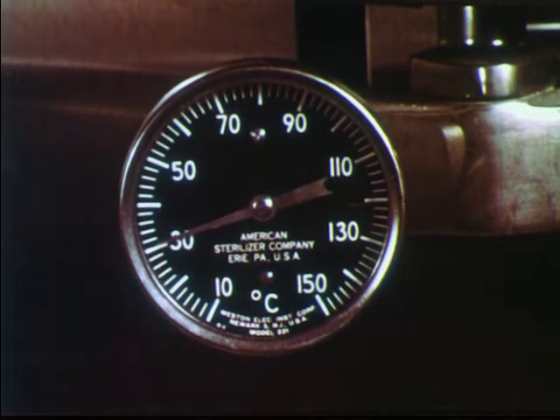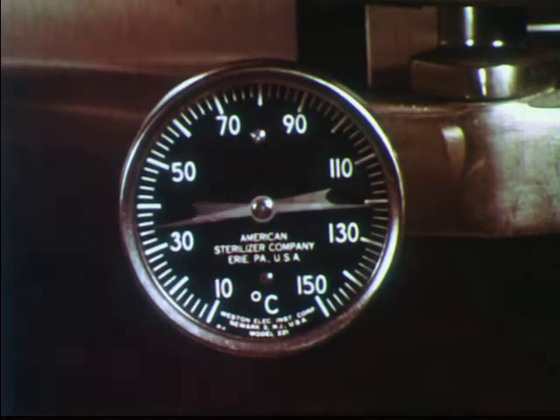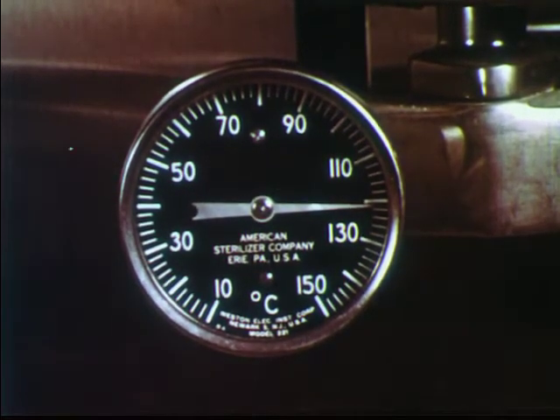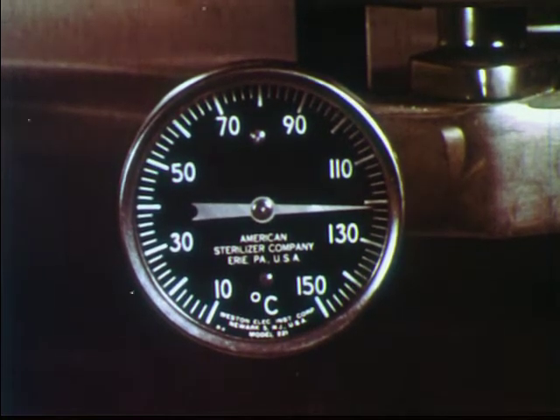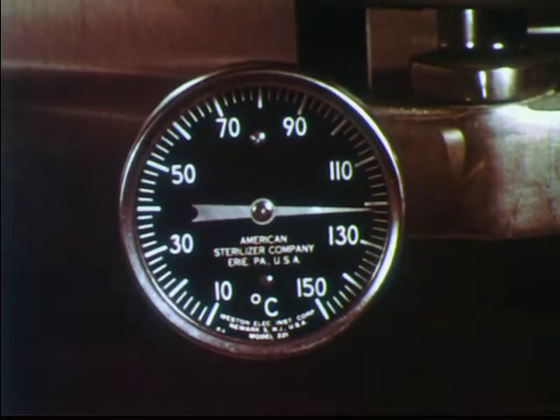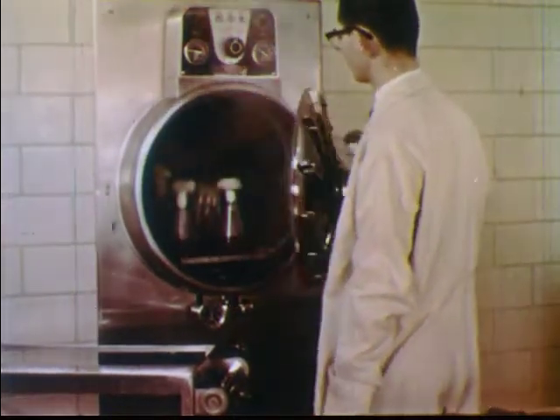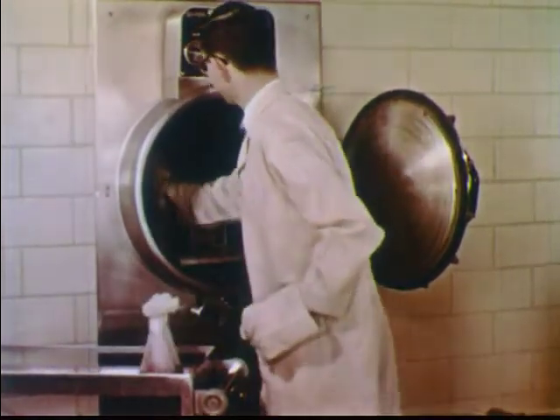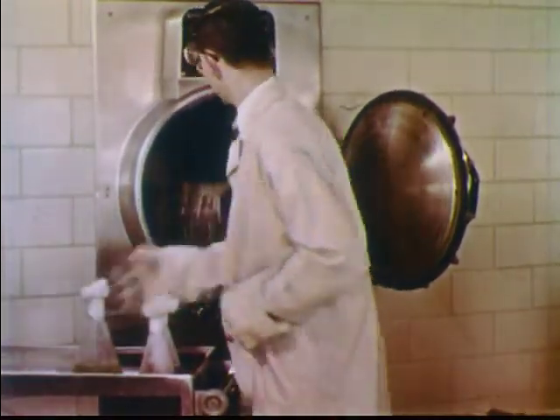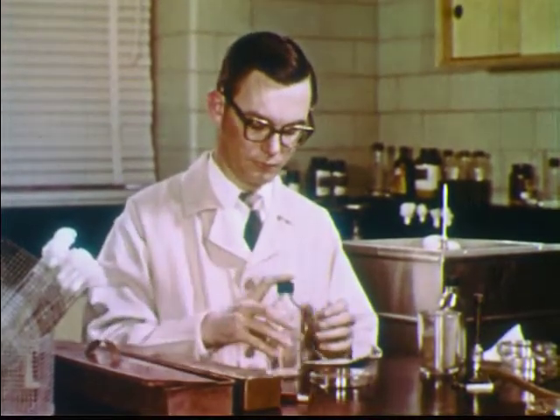As the pressure within the autoclave increases, the temperature also rises until 121 degrees centigrade, or 250 degrees Fahrenheit, is reached and maintained for the necessary time. At the end of the heating period, the containers and their contents are now sterile — free from all living organisms. With these nutrients, study of bacteria can now be made under controlled conditions.